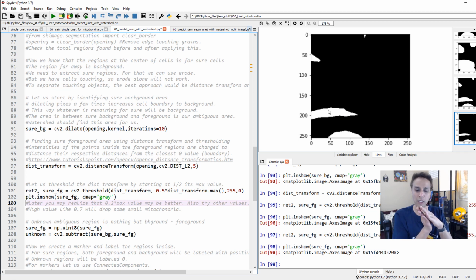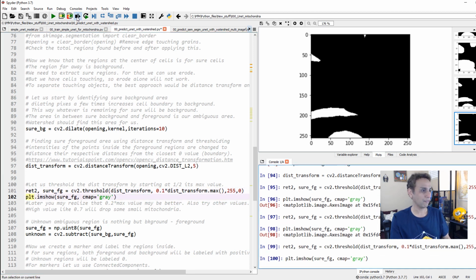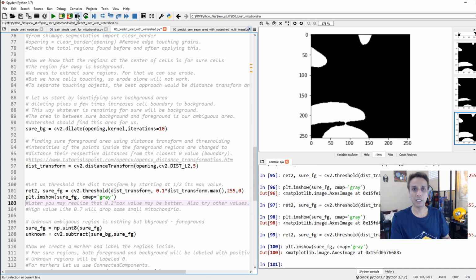Making it too small means now when you actually try to figure out where the boundary is between these two, then the shape would be very weird of this mitochondria, and you lose all the actual shape. So you got to be a bit careful. Let's go down to 0.1 and see what happens. And sorry for spending too much time here, but this is very important for you to understand. Now I changed this to 0.1. You see how that connectivity is still there. When I do that, that means if I proceed, this is not going to help. Okay, and maybe 0.15 will do that.